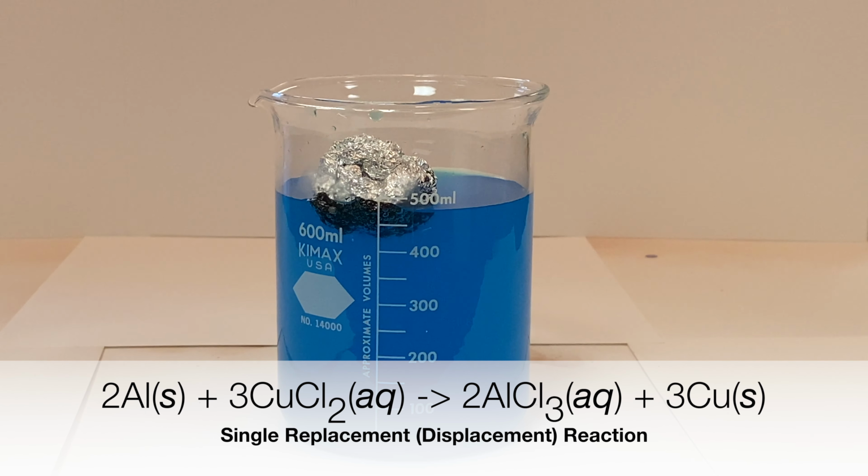In this case, we have elemental aluminum as one metal, and another metal that is forming a compound with chlorine, copper chloride. The copper in the copper chloride switches places with the aluminum metal. This forms aluminum chloride, a new solution, and it frees up copper to be an element. We can see this happen as I speed up the reaction.